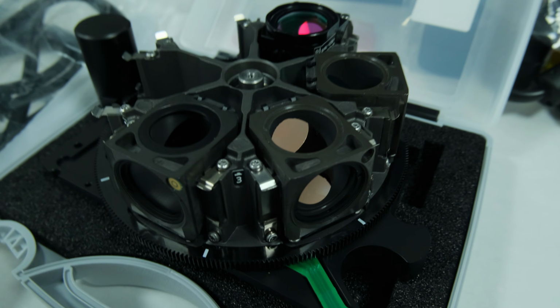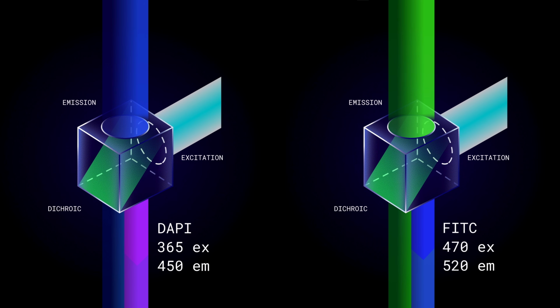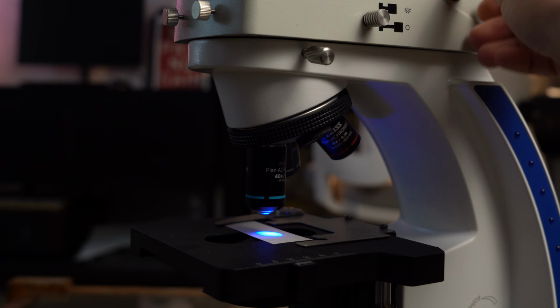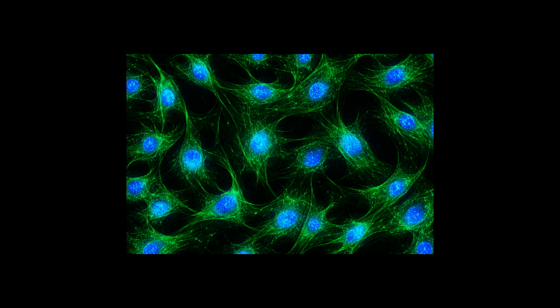The second option is two separate filter cubes. In this case, you'll need two cubes that match your dyes. With this setup you can get two images, one in the blue channel and one in the green channel. Then you adjust the exposure for each channel and capture a clean, detailed image. You can also switch your camera to monochrome mode to get nicer pseudo-colors.